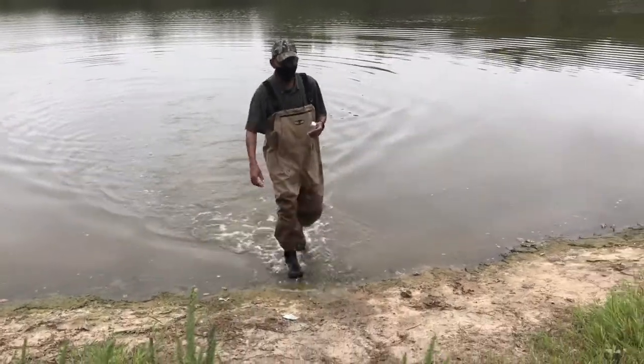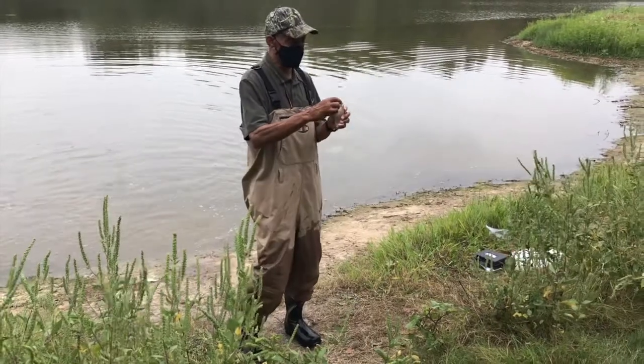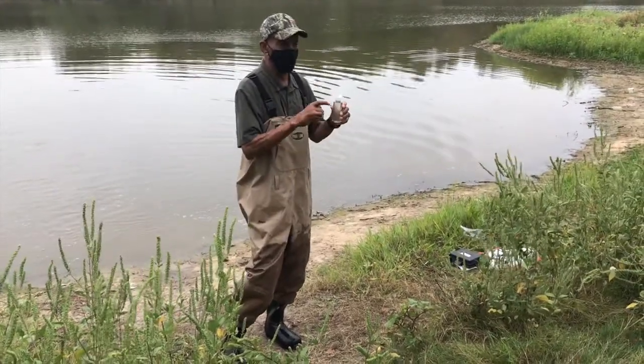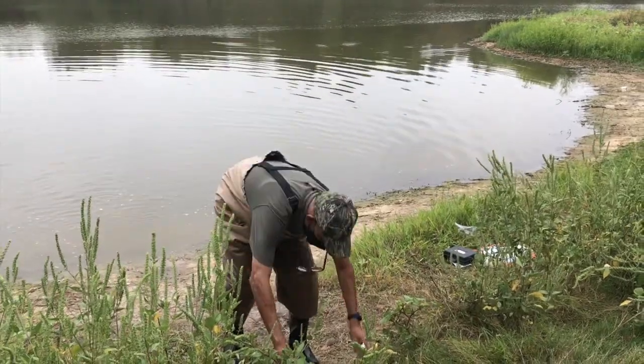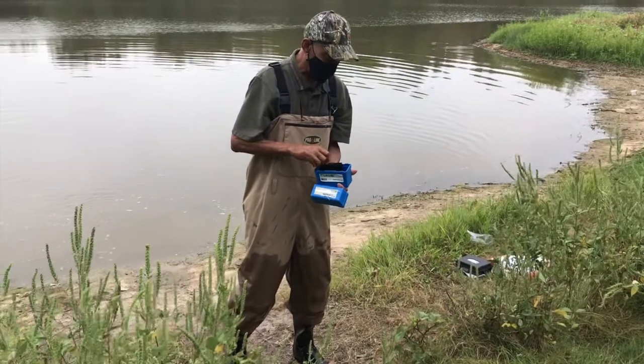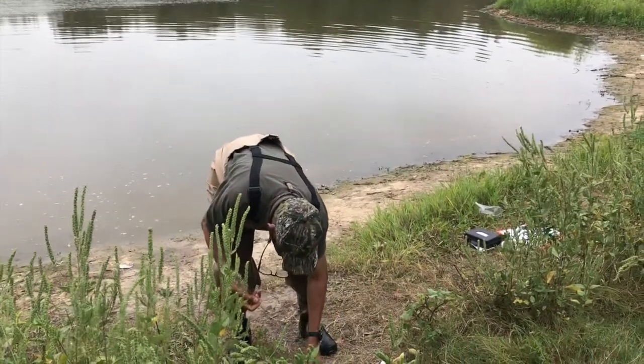And since we're doing this out in the field, I didn't use the other type of container that I use. I used a container that has a little spout because we're going to have to measure the amount of the sample water that we're using. In the kit, we're going to run 2 tests because we want to make sure that it's accurate.